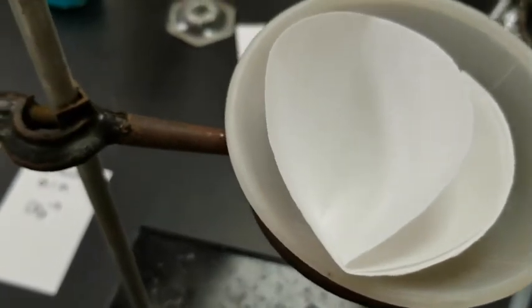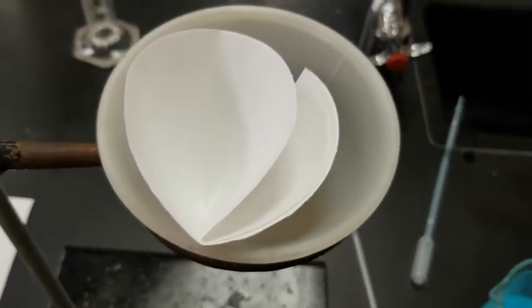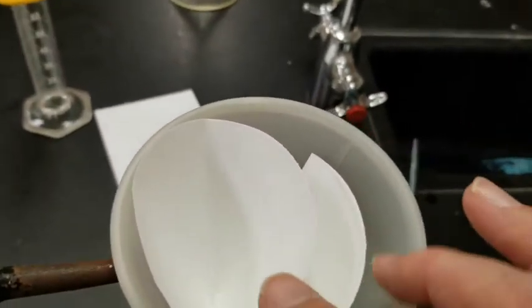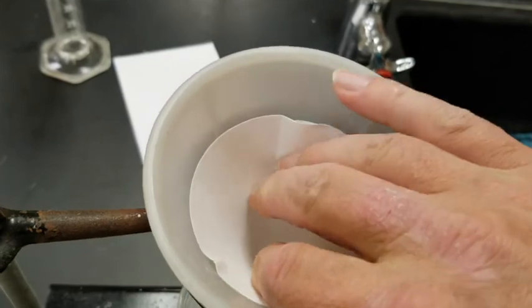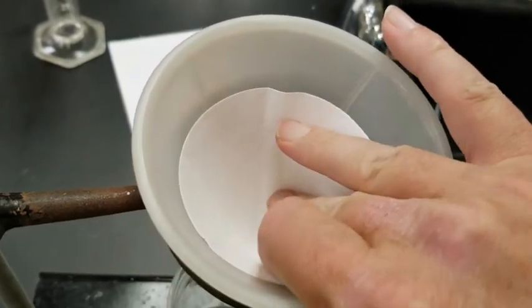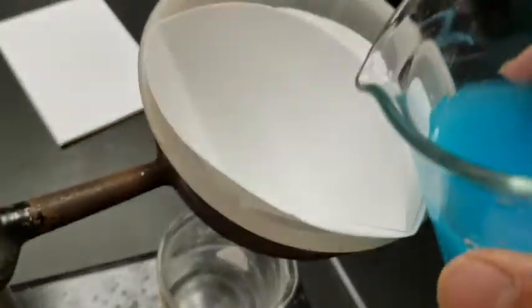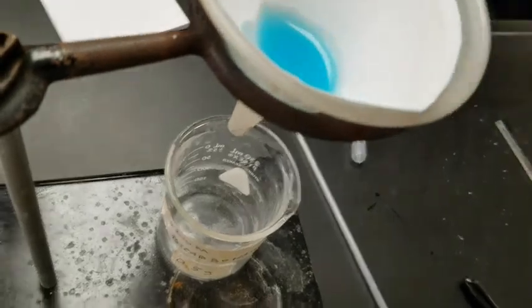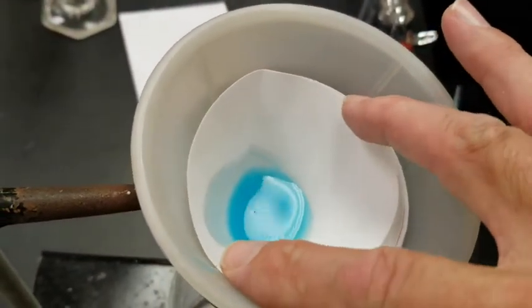And now what we're going to do is we are going to pour this here through our filter paper here to collect all of the precipitate. So once again, you want to set this up so that it's 3 in 1. It doesn't really matter which way you do it as long as it's 3 in 1. Go ahead and shove that guy down in there, and then take your precipitate and pour it right into that one layer that's there. Put a little bit in, and it will start to drip through.